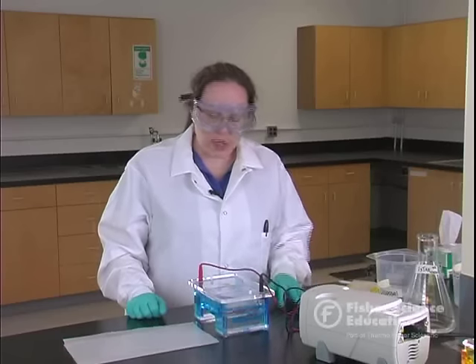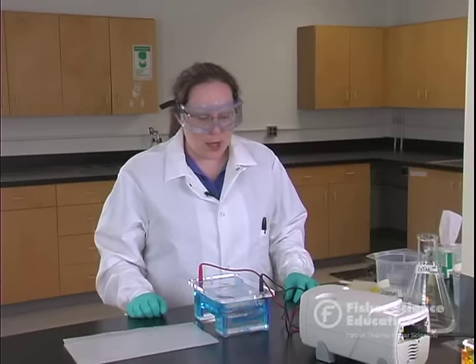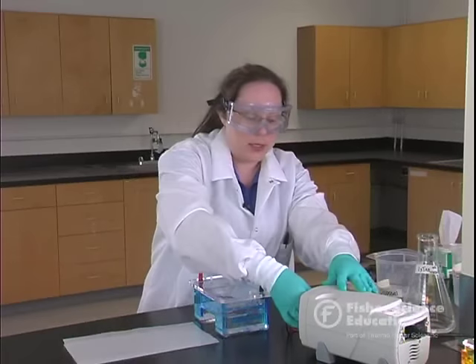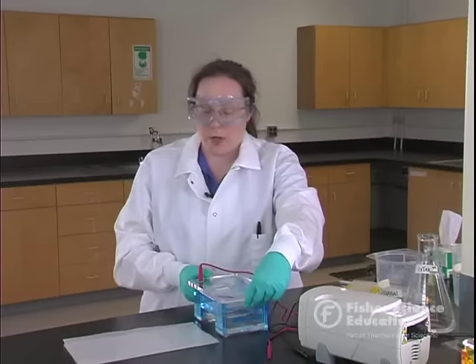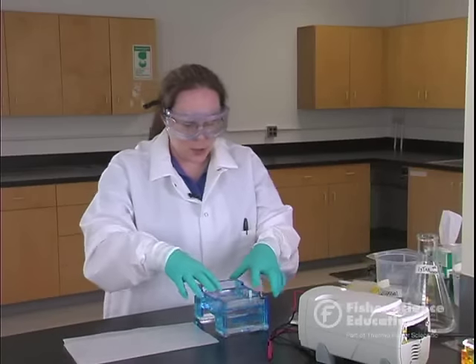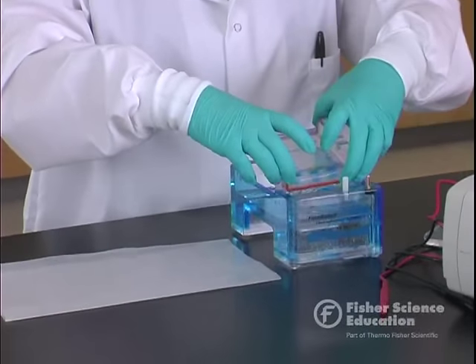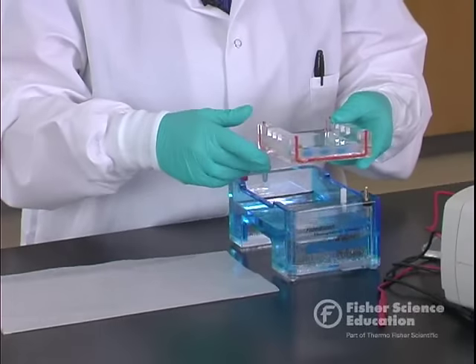Now we're ready to check the results of our electrophoresis of the homemade dye recipe. My timer has ended, so I'm going to turn the power off and flip the switch so there's no power running to the system. I'll disconnect the leads from the power supply, and only then will I remove the lid from the electrophoresis chamber. I'll pull the gel out of the chamber, lifting straight up out of the buffer, and let some of the excess buffer run off.